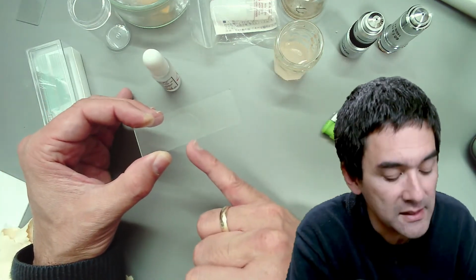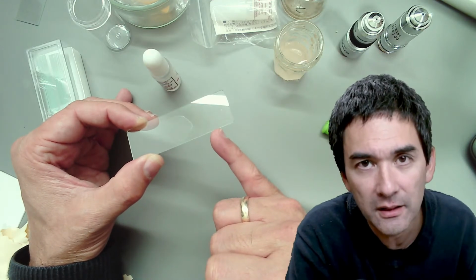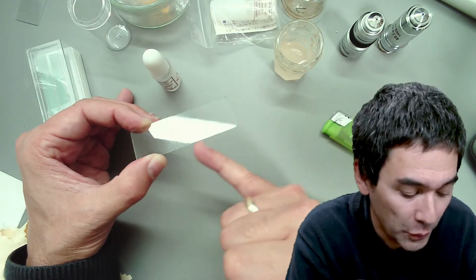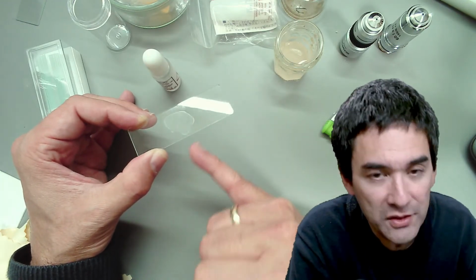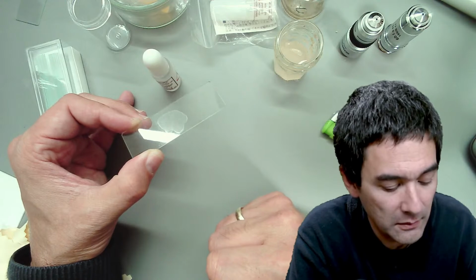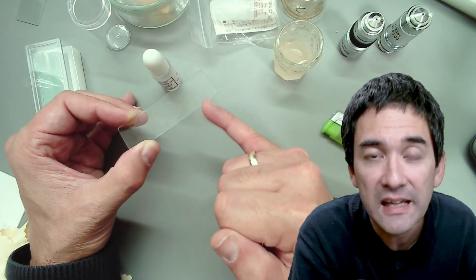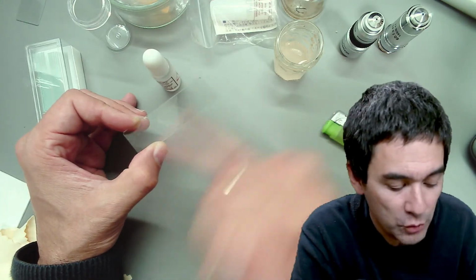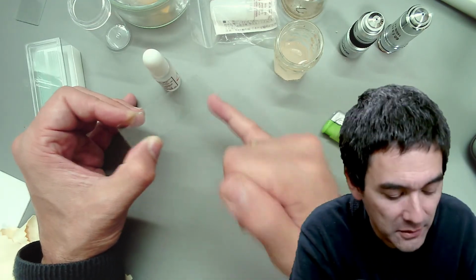By heating it, the cells, of course, die, but they're baked to the glass slide, just like an egg is baked to a frying pan and sticks, because somehow the proteins cross-link with the glass. This is important because otherwise, if you want to stain it, the stain would flush the cells away, and we don't want that. For this reason, you heat fix it to bake the cells to the glass slide so that you can do staining. For example, there's been a request for me to show how to do gram staining for bacteria. You have to change the stains several times, but you do not want the cells to be washed off. For this reason, you need to bake them to the slide.